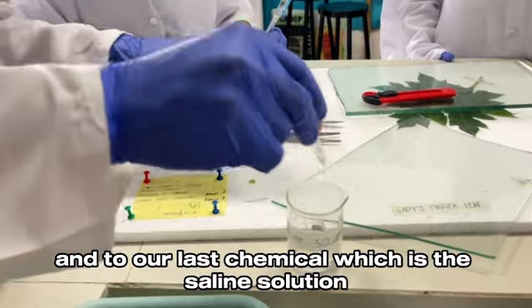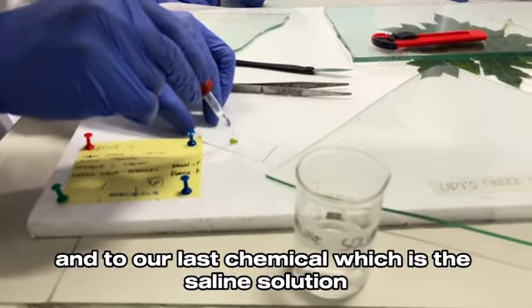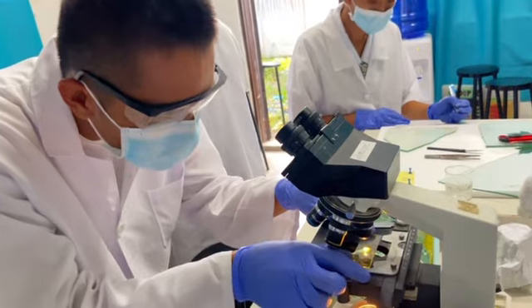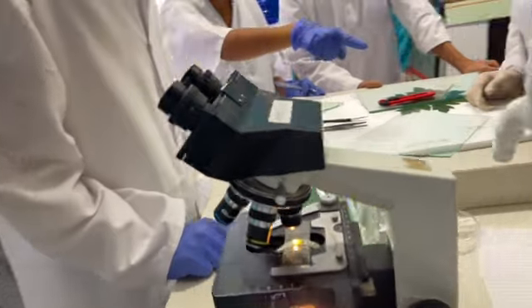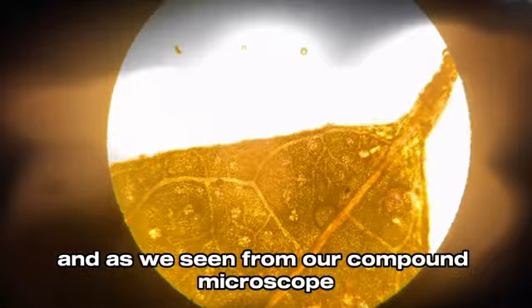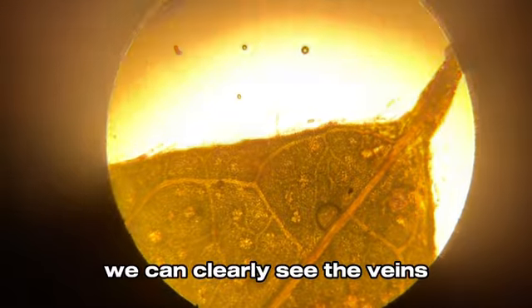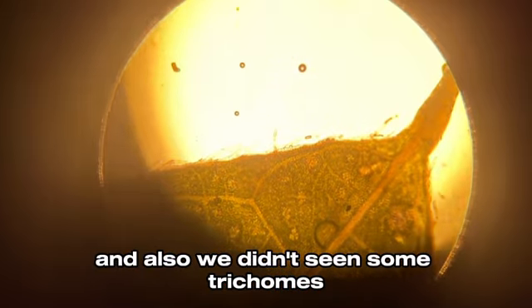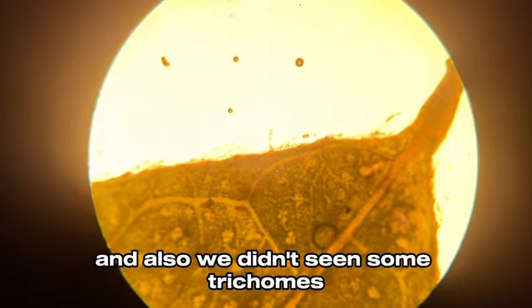And our last chemical is the saline solution. As we see in our compound microscope, we can clearly see the veins, but because of the chemical, the leaf was burned. And also, we didn't see some trichomes.